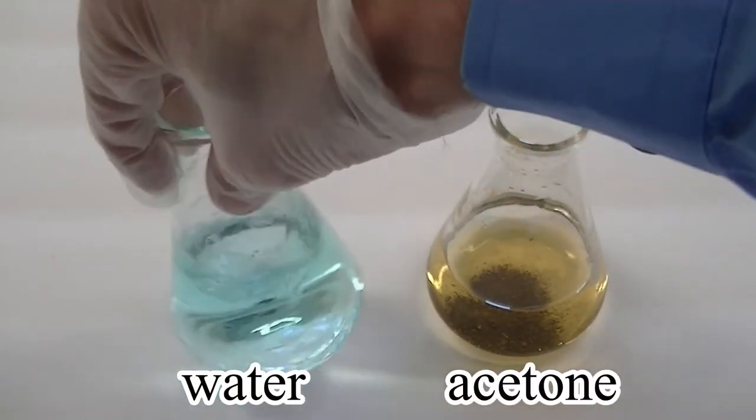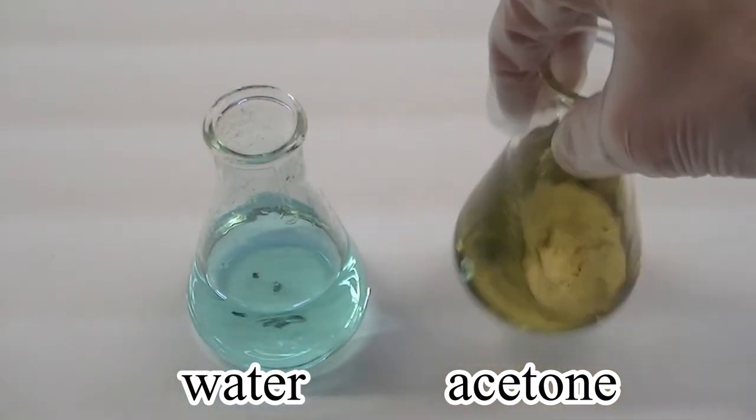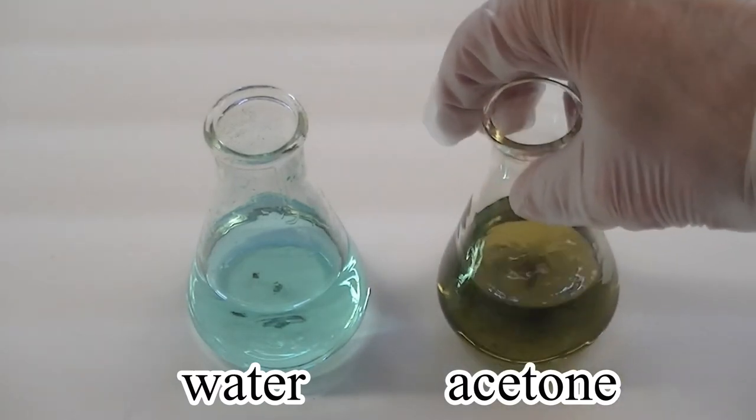Notice the striking difference in color in the two solutions. It is hoped that by the end of this video, you'll be able to describe why these two solutions have different colors.